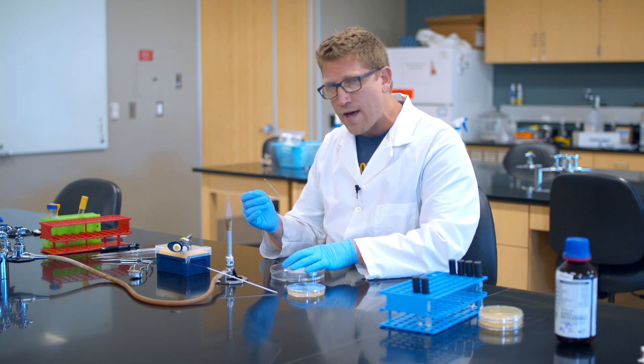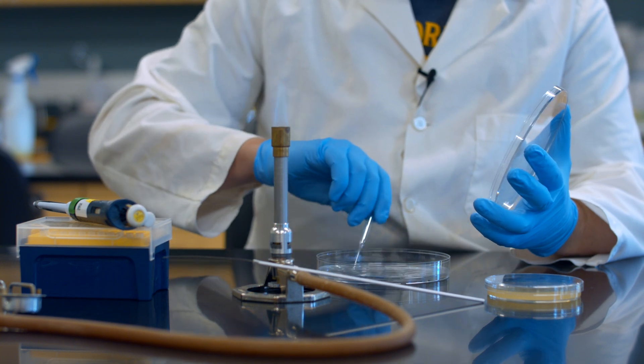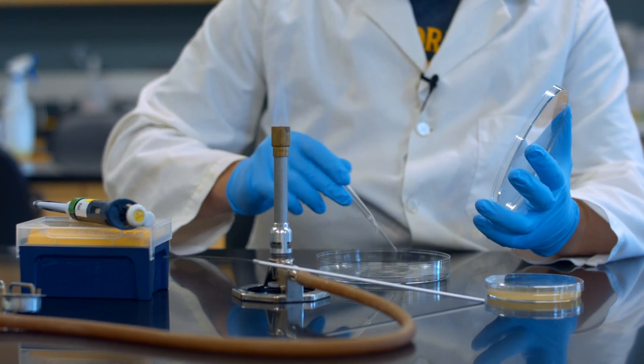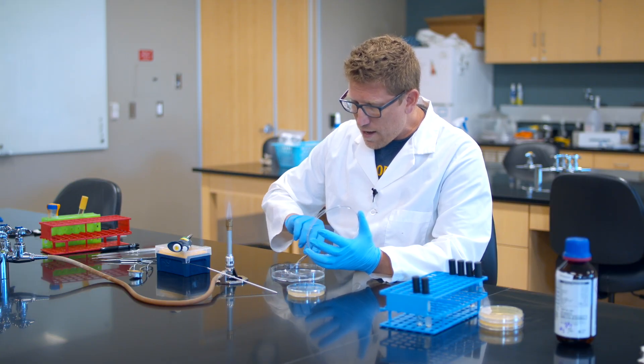So what I'm going to do is I'm going to put it in some ethanol first. This is absolute ethanol. This kills the bacteria itself, the ethanol alone kills the bacteria.